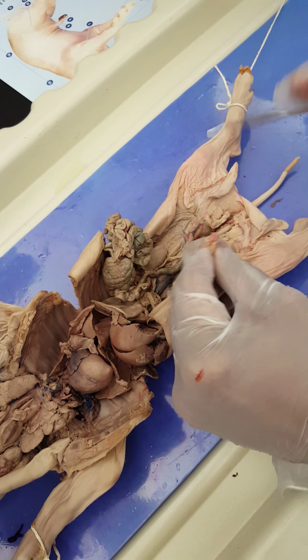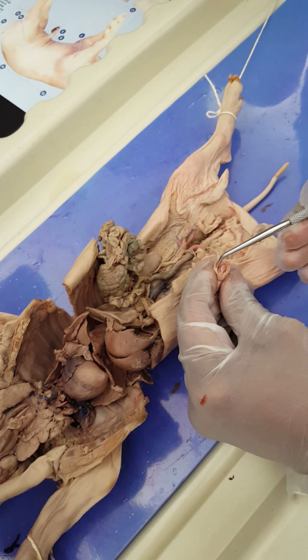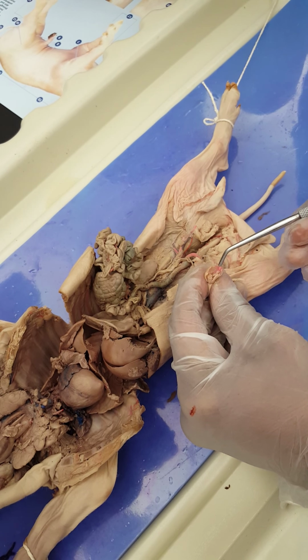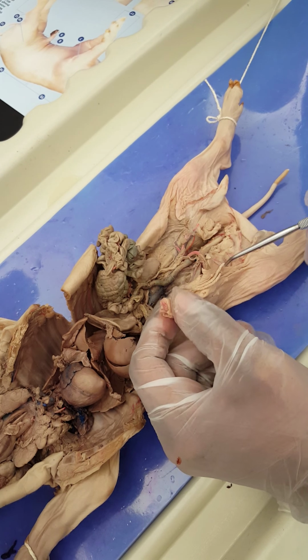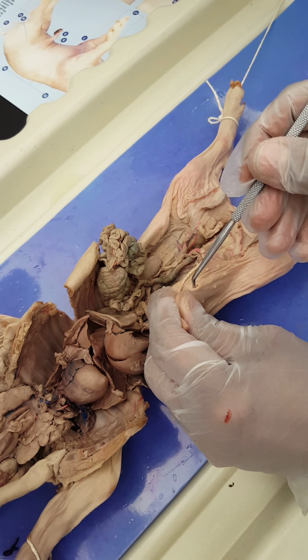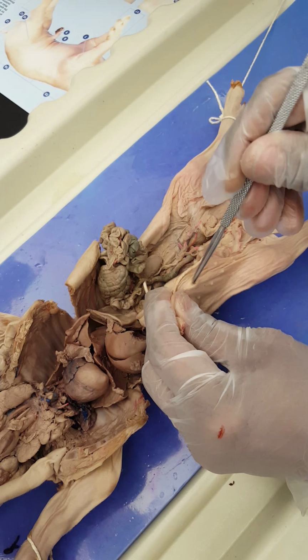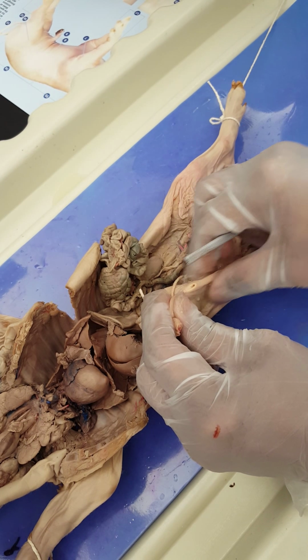Just go over it again here, cross section. It is two arteries and a vein. See that? I'm going to put the probe in the opening of one of the arteries here. Okay. And this is the urethra. I'm going to put the probe here inside the urethral orifice. This is the urethral orifice. Okay. Right here. And this is the penis.